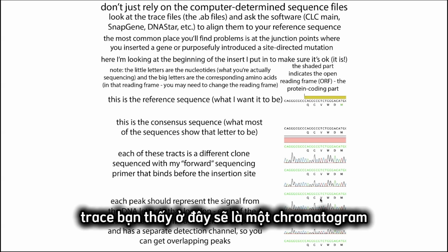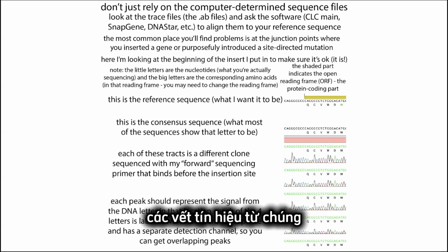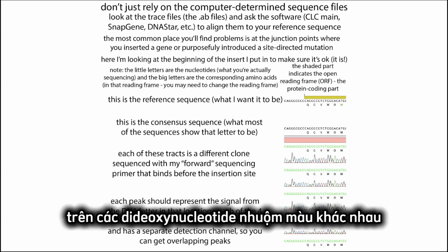So basically the trace you see here is going to be a chromatogram showing you the different DNA letters, the traces from them, the fluorescent traces from those dye molecules on those different dideoxynucleotides.